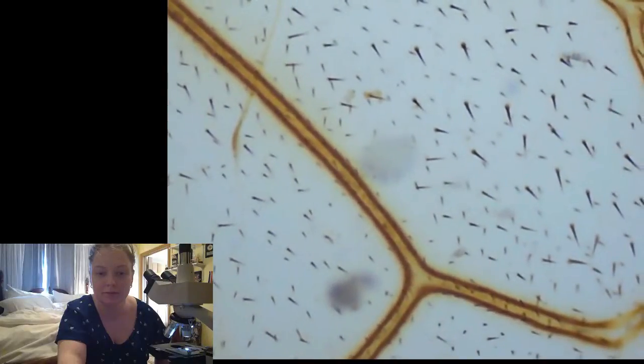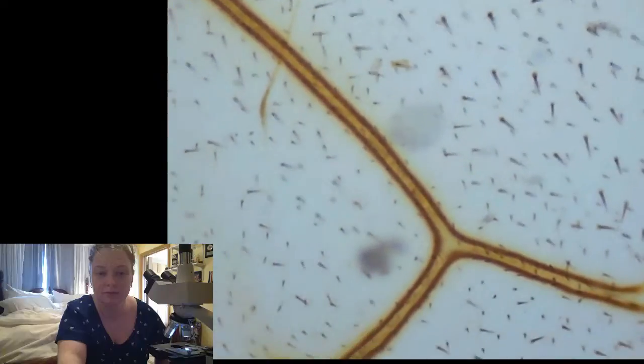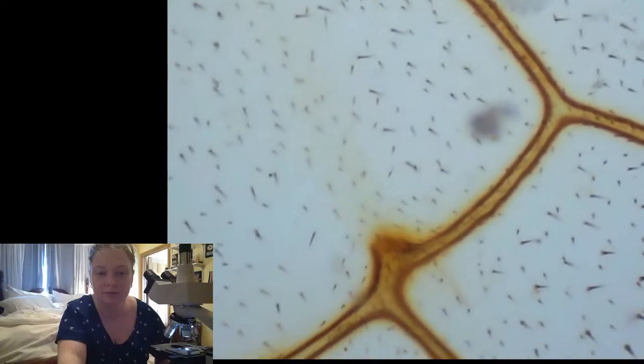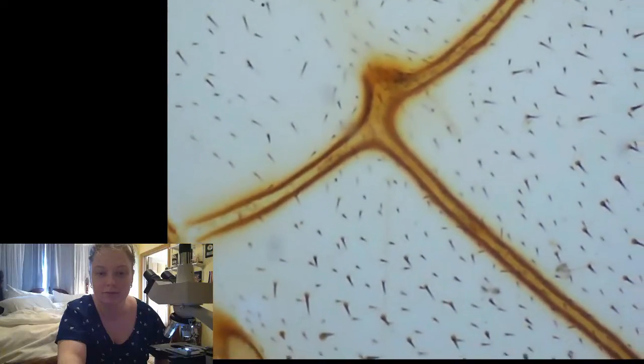I did not realize bee wings... I wonder what kind of bee this is from. It doesn't say, it just says bee wings. It would be interesting to know what species of bee this comes from.